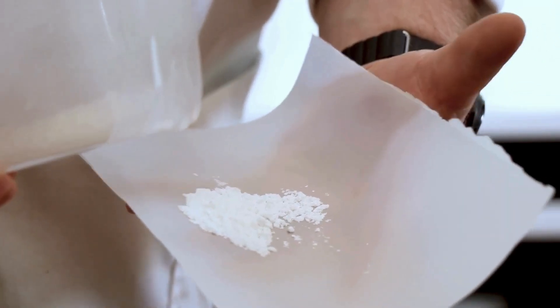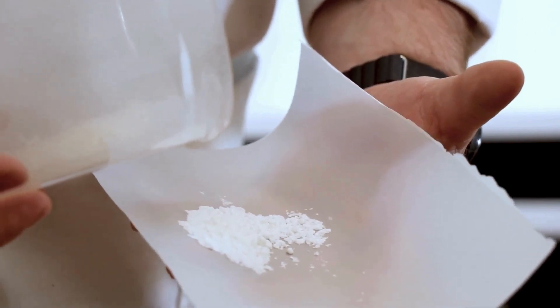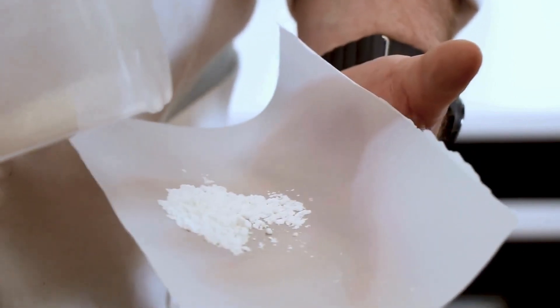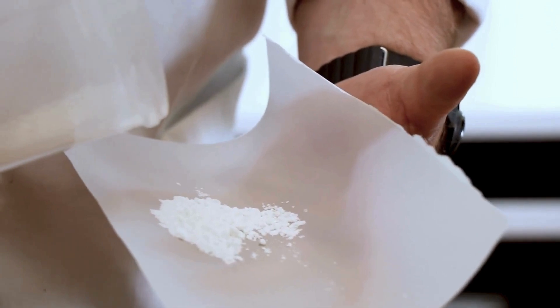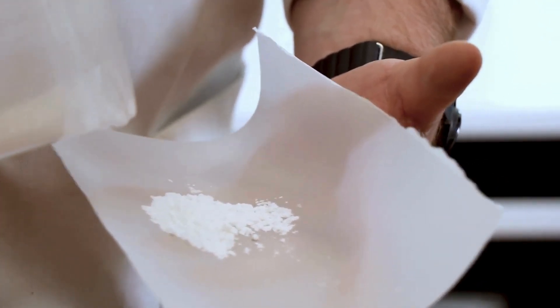To unload the sample, you just scratch it off. Normally the sample is very fluffy and powdery, so you can collect something like that. With this, you then go to further analytics — a microscope or a moisture scale — to see how efficient your drying was.